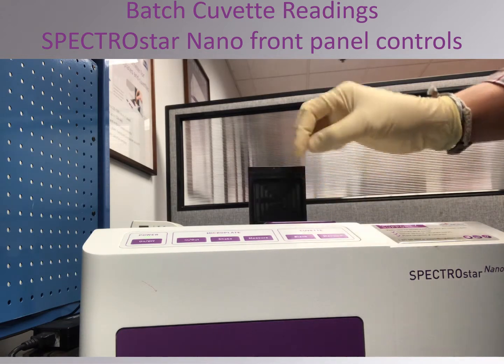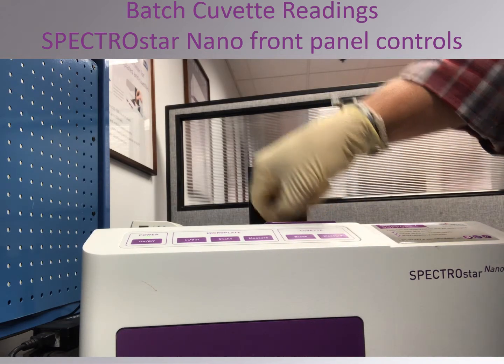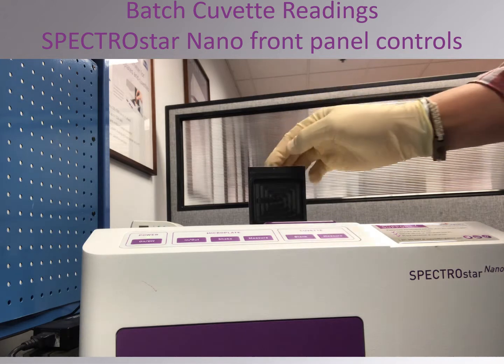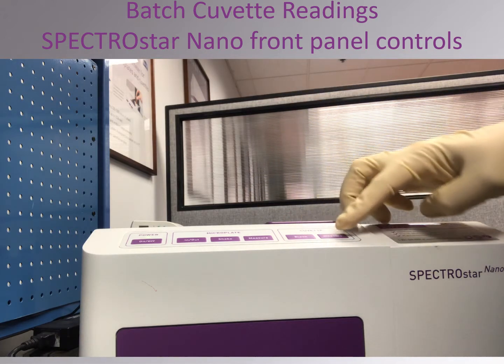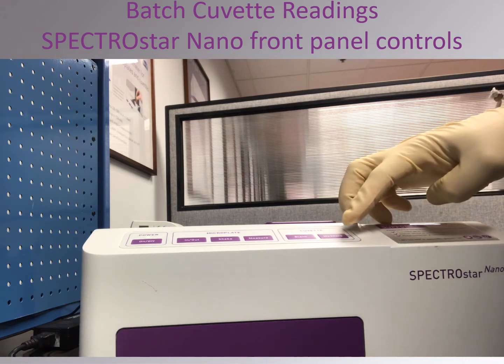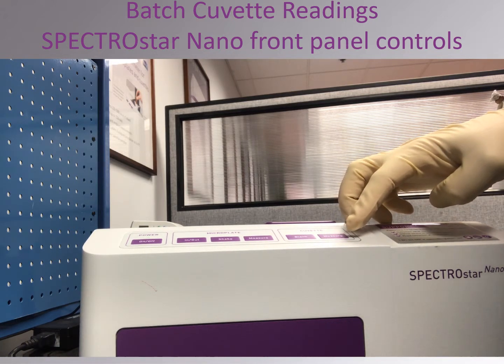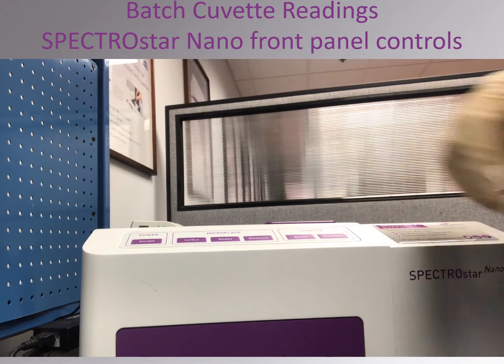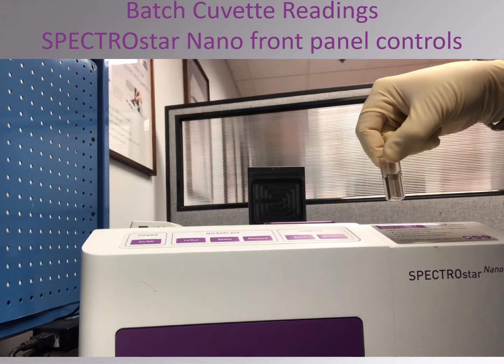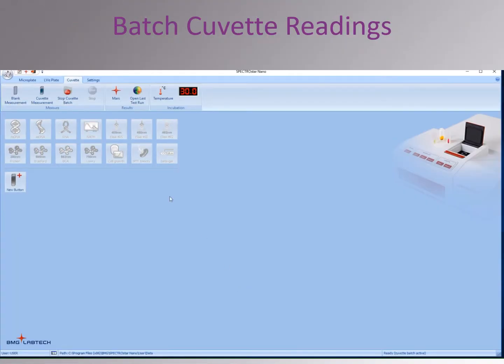Here, you can see how to change cuvettes. Reading of a blank can be done with these external controls, but since that has already been done, this new cuvette is read by clicking Measure. When all of the cuvettes have been read, click Stop Cuvette Batch.